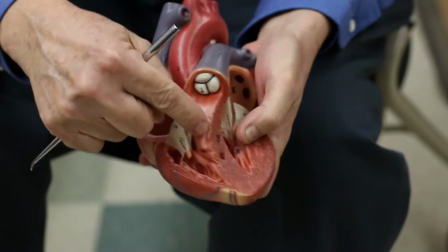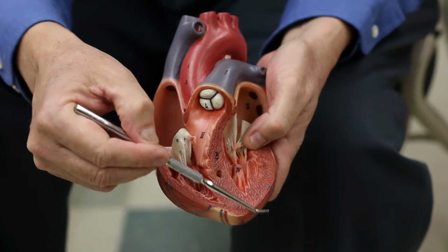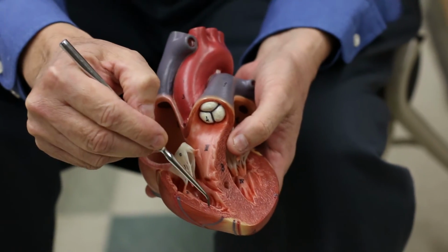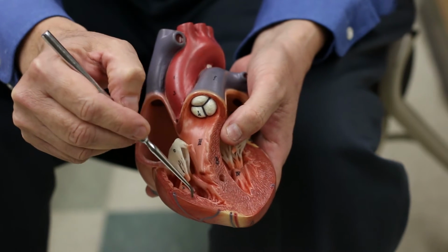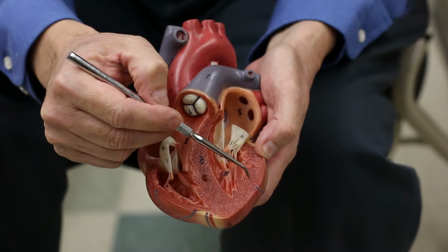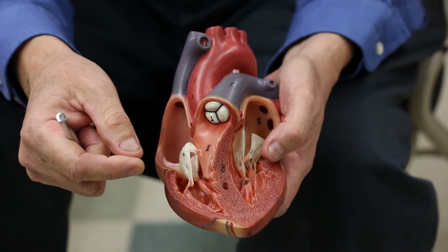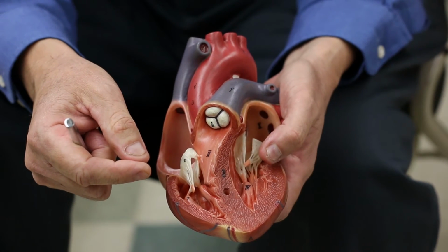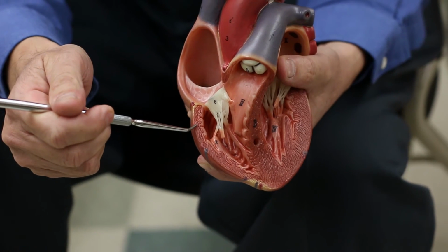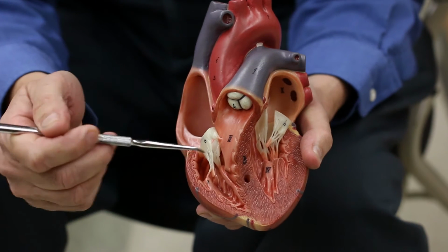No matter your window, it's probably not going to come down this far, all the way across the bottom of the heart, taking in the apex. The reason to do that is you'll get a section with the width of the right ventricle wall and the width of the left ventricle wall. And by making a cut across here, it's really easy to compare the thickness of the walls. And you'll see that this thickness, you can see it in the model here, is much less than the wall here.